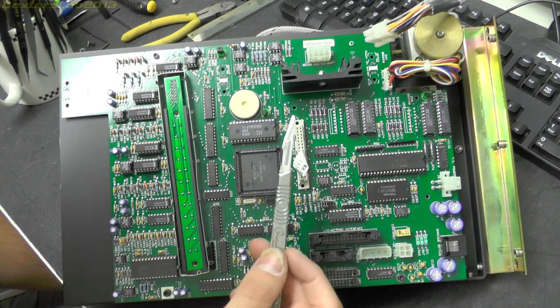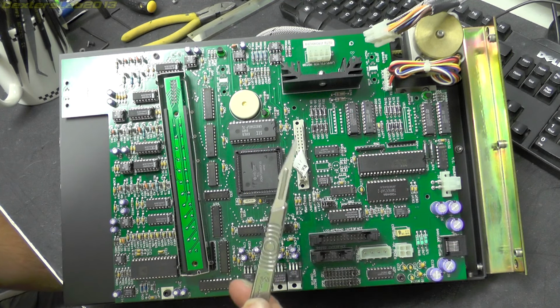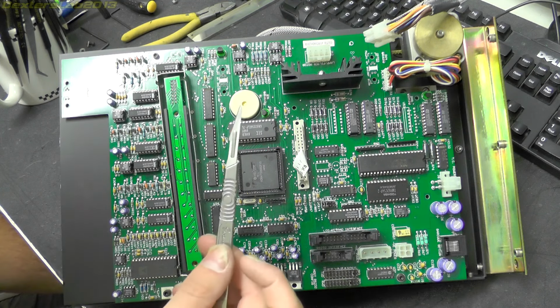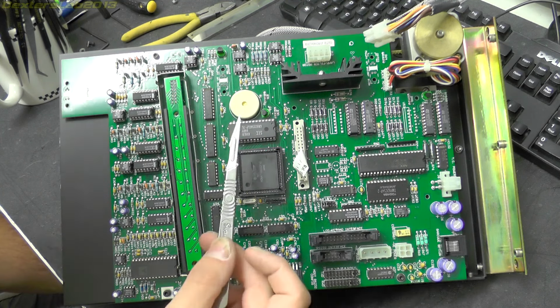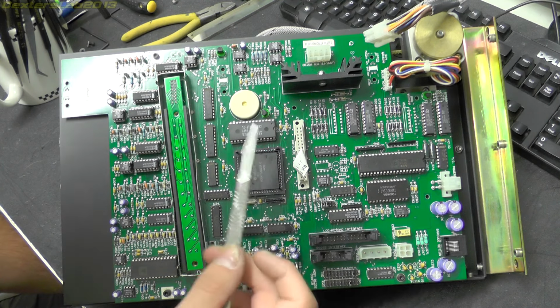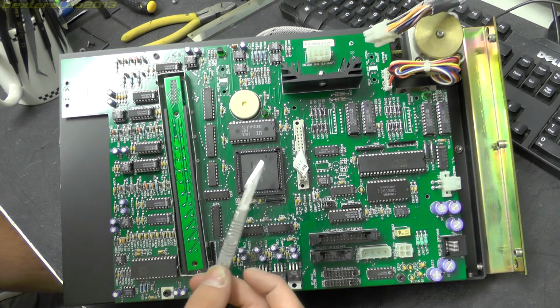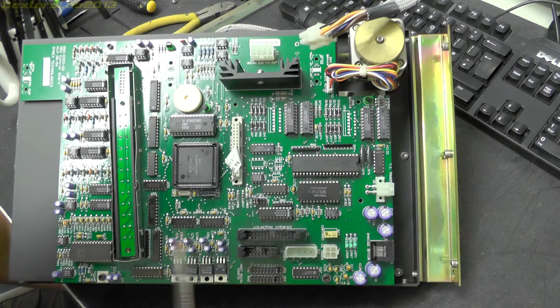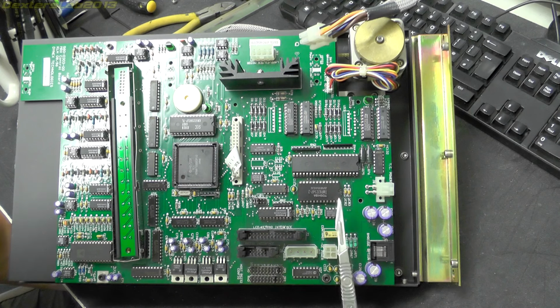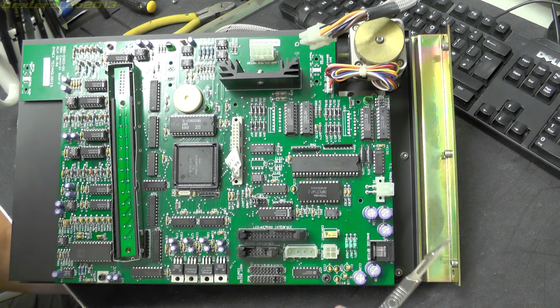And right next to that we have an SEC KM62256CLP-7L, and that is a 32K CMOS static RAM. So obviously they needed a bit more memory, so they've just thrown that in there, and it has a small amount of external memory to use with the microcomputer. And working our way back up to the top, we have a Toshiba TMP82C54P-2, which is a programmable interval timer.